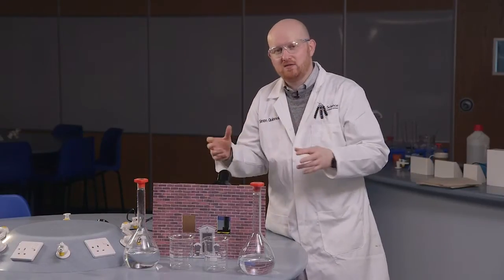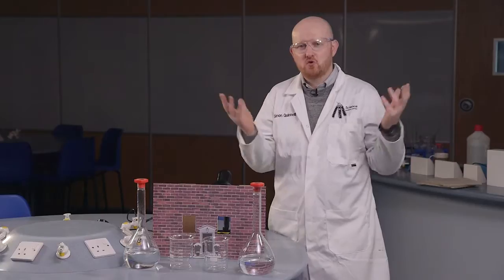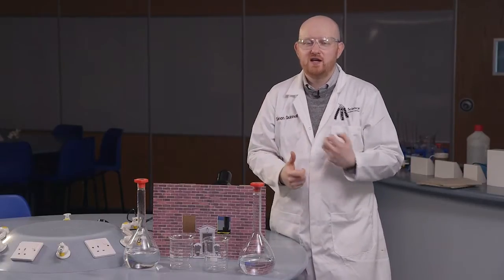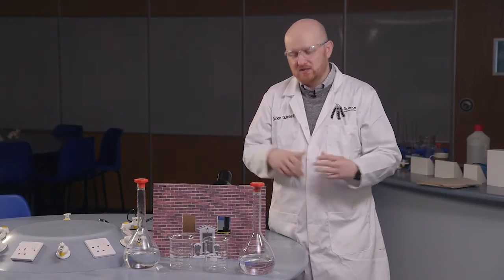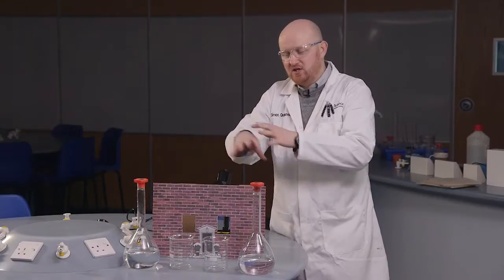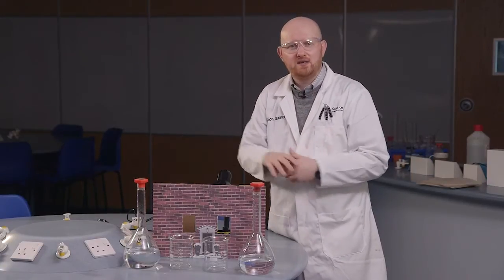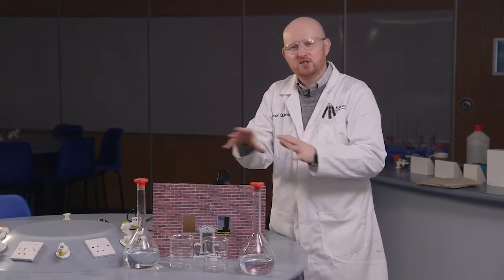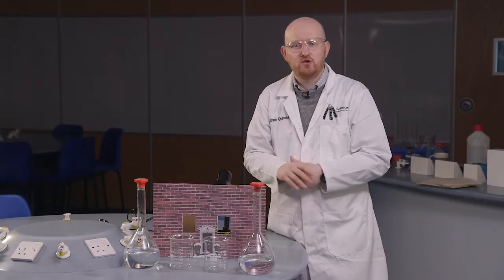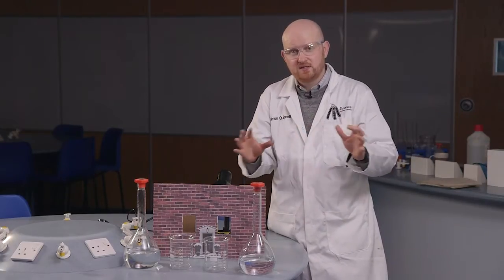And whilst the beakers are behind the windows, we're then going to add solution B to those solutions and after about 10 to 20 seconds the iodine clock reaction should start to work and that solution will go from a colorless solution to a dark black solution. By doing that we're turning the lights off, drawing the curtains, going to bed, ready for Santa to come and visit us.